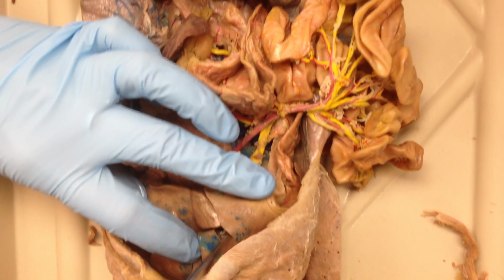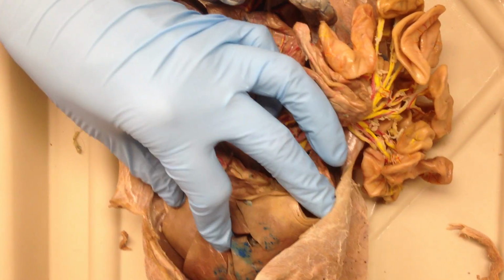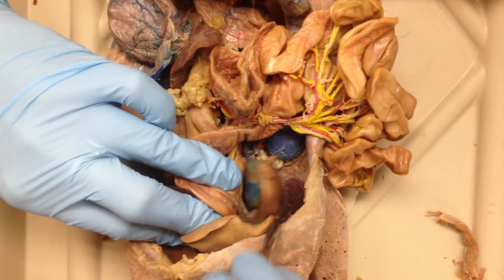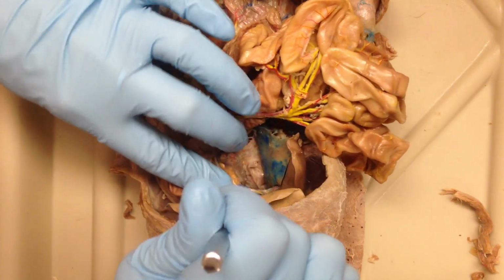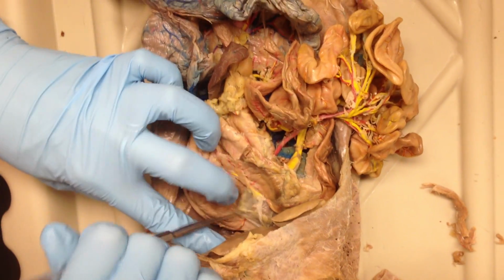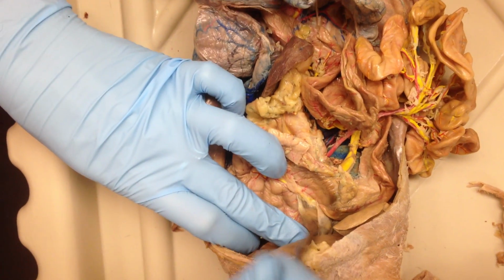So even though this looks like a split, it's not. You can tell because it's still together at the back. So all of that is right medial. And then right lateral is way over here. And then right next to it, actually, in your animal, it's kind of hidden behind back here. This poking through now, that's your caudate lobe, that little tiny guy back there.